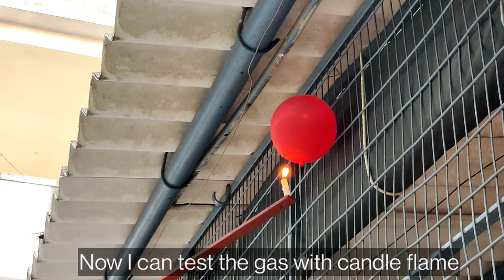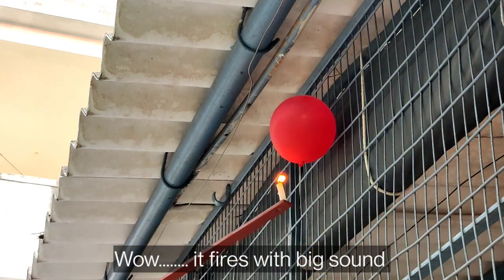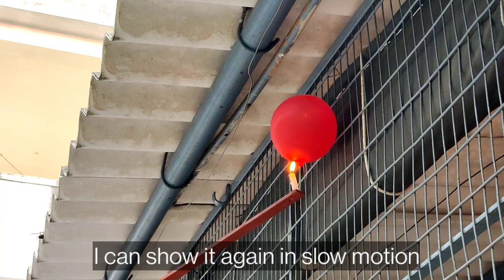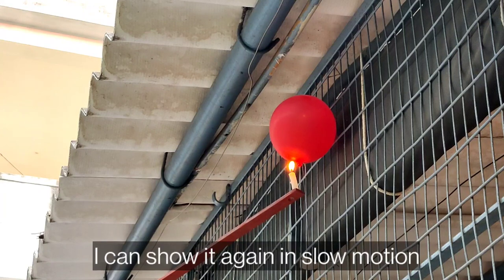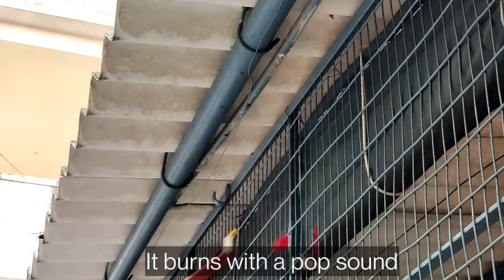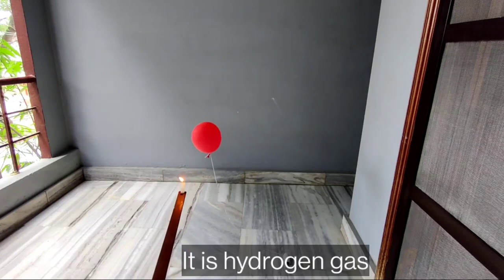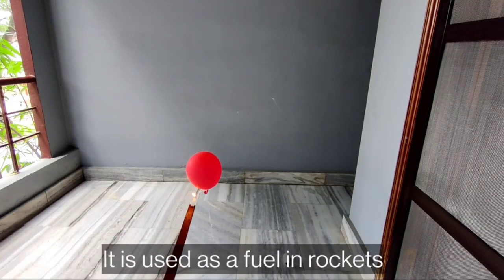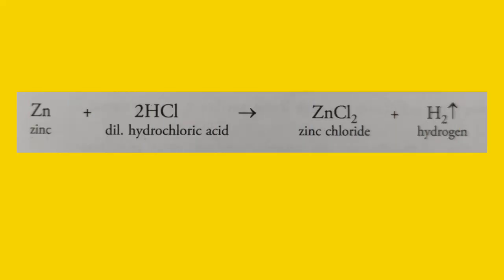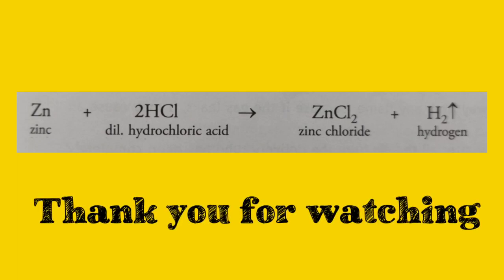Observe carefully — wow, it fires with a big sound! I can show it again in slow motion. It burns with a pop sound. It is hydrogen gas, which is used as a fuel in rockets. The chemical reaction is: zinc plus hydrochloric acid gives zinc chloride plus hydrogen gas.